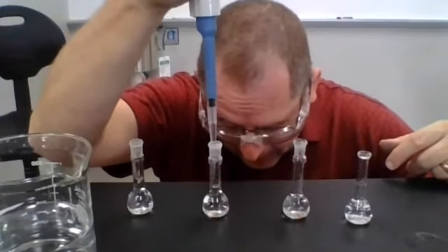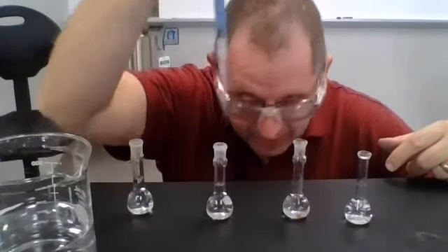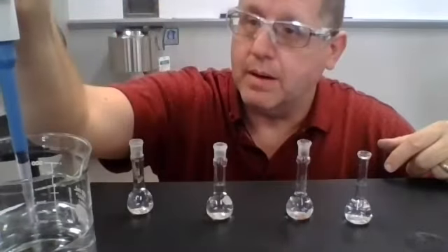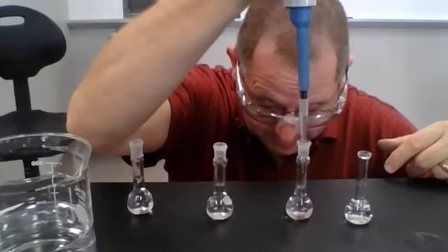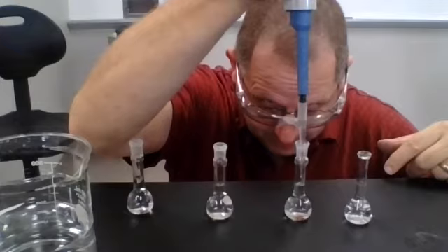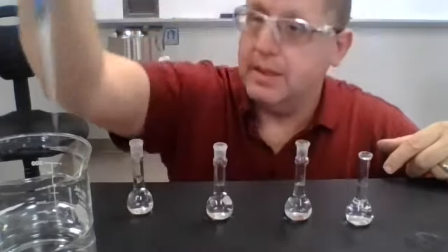I will need to parafilm each of these and mix them well. I will probably do that off camera. But I will let you see the making of each of these solutions.